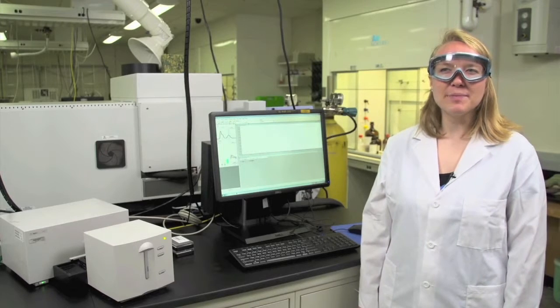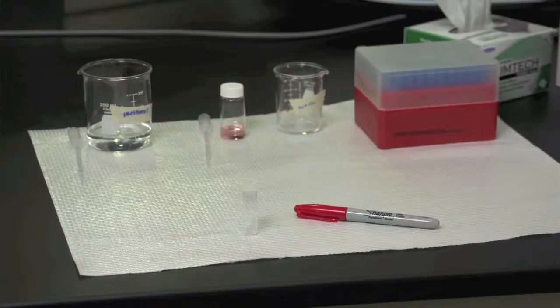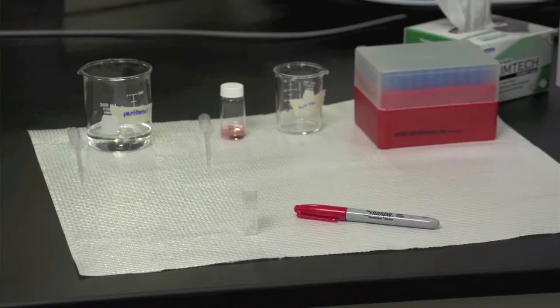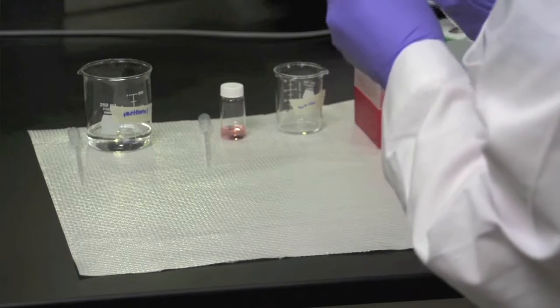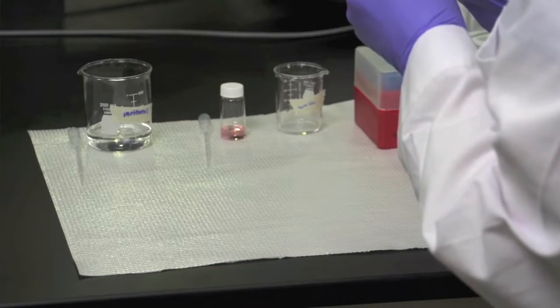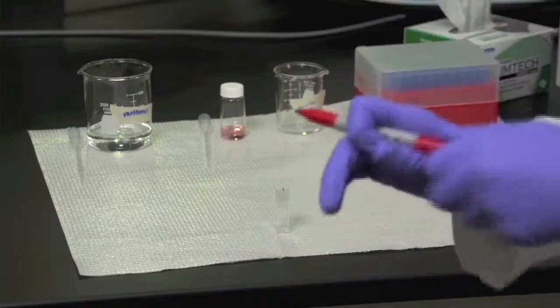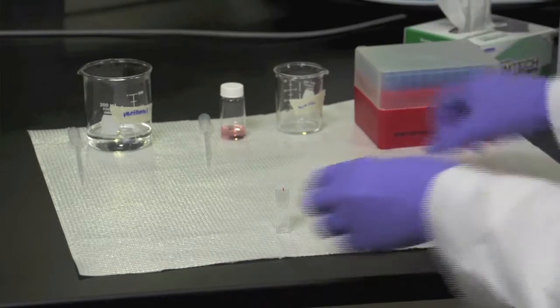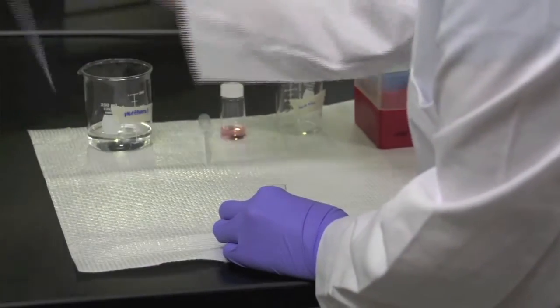When the instrument's warmed up, you can take the blank to account for the solvent and the cuvette. You'll want to put gloves on for this part. Select your cuvette and mark the top with a sharpie so that you can tell that the orientation is the same every time you use this cuvette. Then fill it with methanol to take the background spectrum.